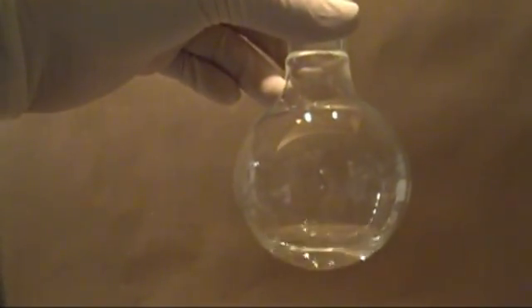Here's what mine looked like after I pulled it off after about 10 minutes of distillation. Now we need to test it.